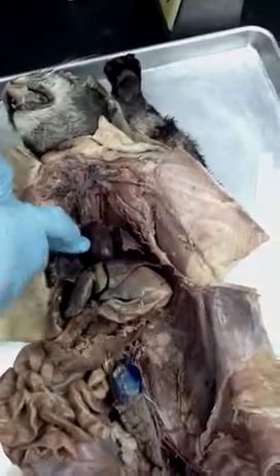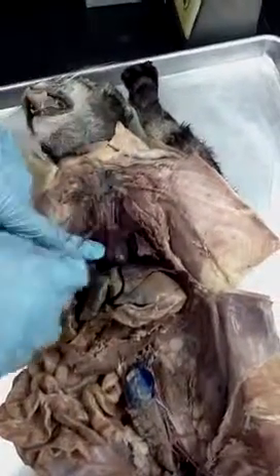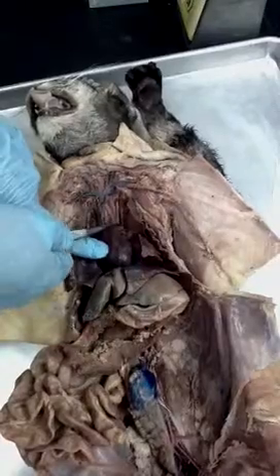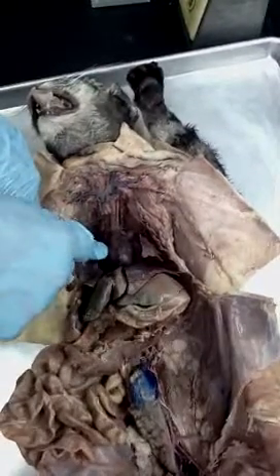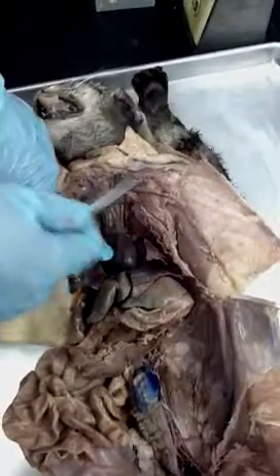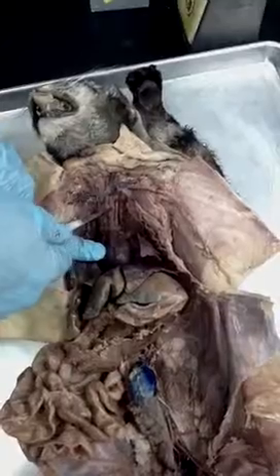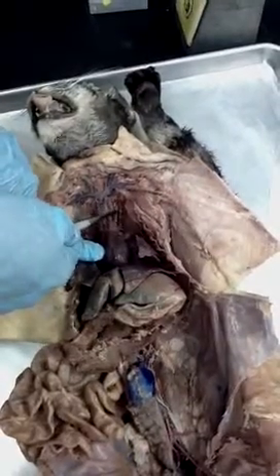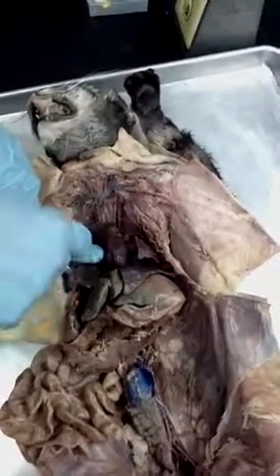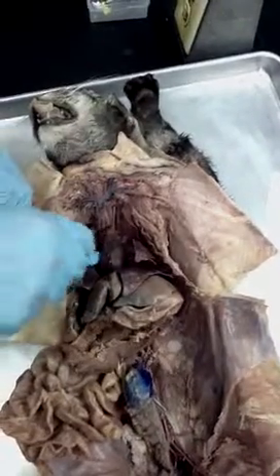And then the aorta, where the blood is actually going up. The aorta comes up here. There are 2 branches out of the top of the aorta, at least in the cats. Humans have 3, but we've got the brachiocephalic artery and the left subclavian. Left subclavian will go up here and go around the top of the ribs and into the arm.